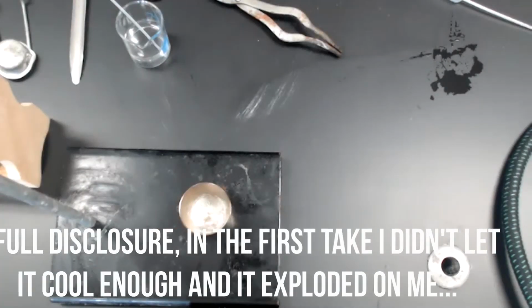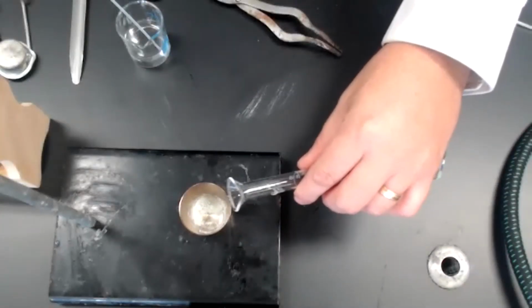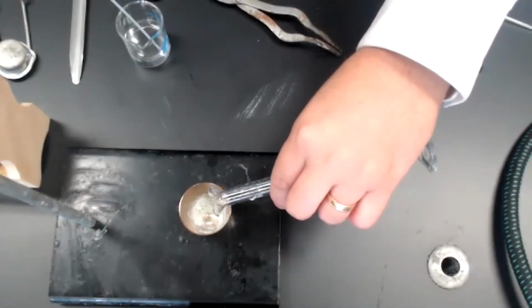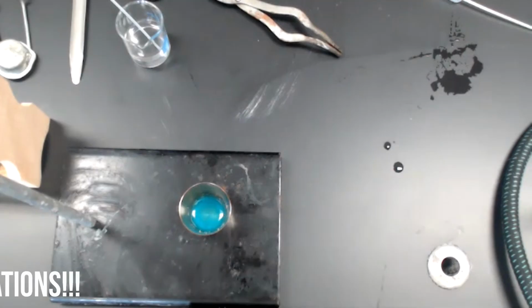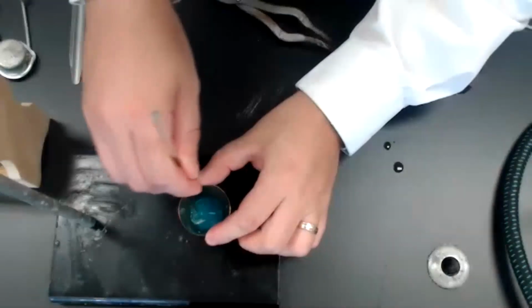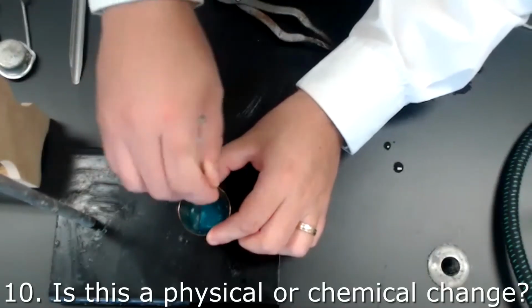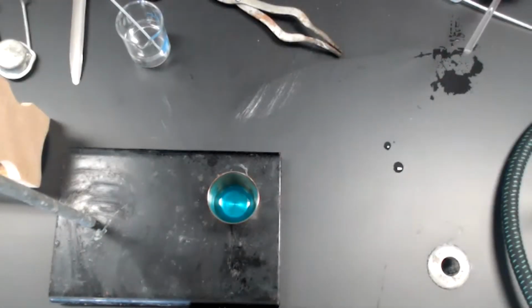For our next step, we will rehydrate the sample by adding some water. Pay attention to the change. Notice the white powder has now changed into a blue solution. Just going to mix this up. Okay, our sample has now dissolved.